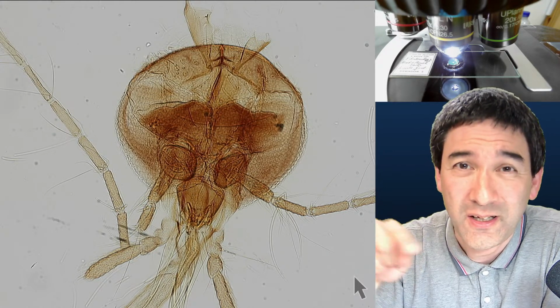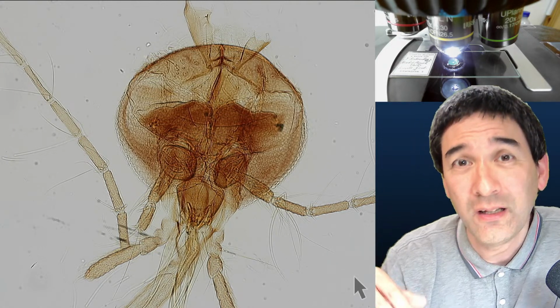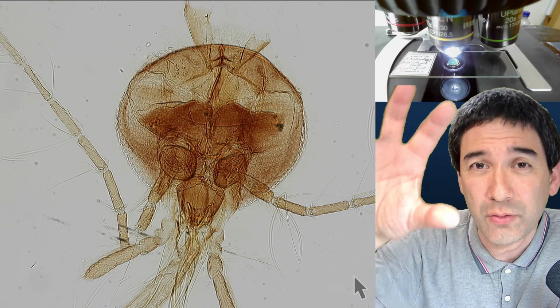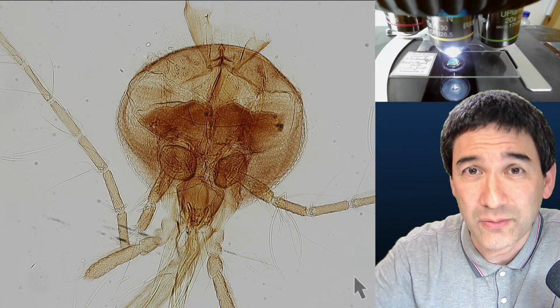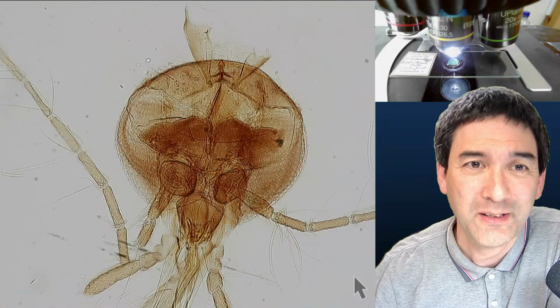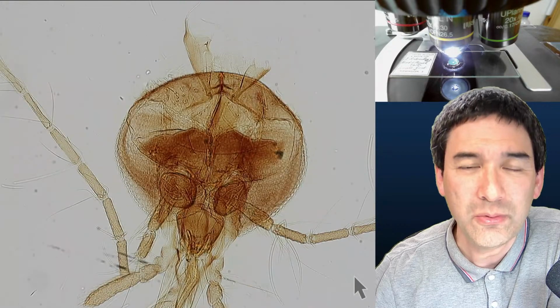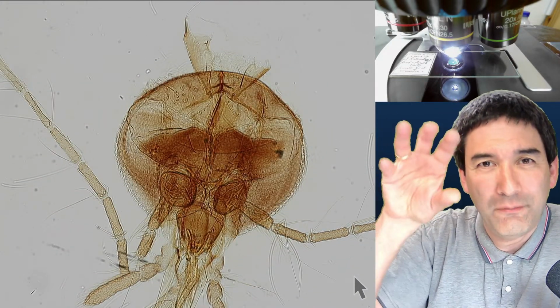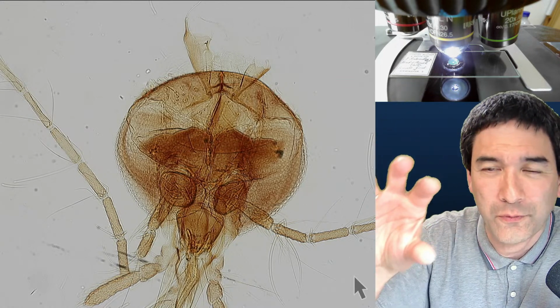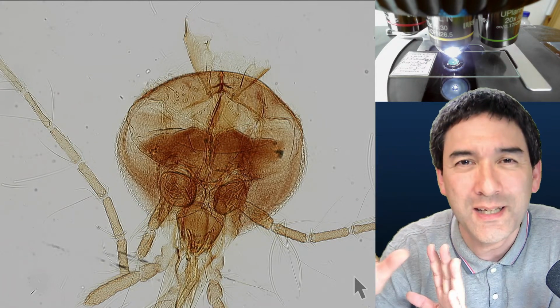I cannot do it now here live in OBS Studio, but if you watch some of my videos on this channel, then occasionally I have a smooth view transition of a camera across the slide. I cannot move so smoothly by rotating the knobs of the microscope. If I try to move, it's not very smooth. So what I usually do is take a very large picture, define a starting point and an end point, and then allow the software to move smoothly. You can also add some rotation and some zooming and so on. So you can go really crazy and try all of these things.